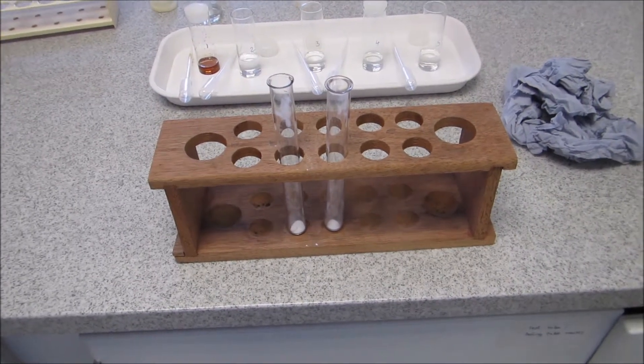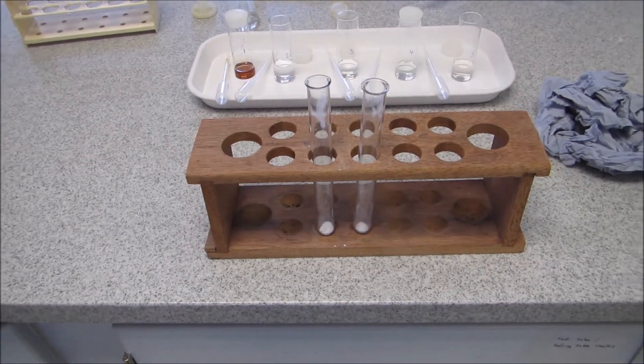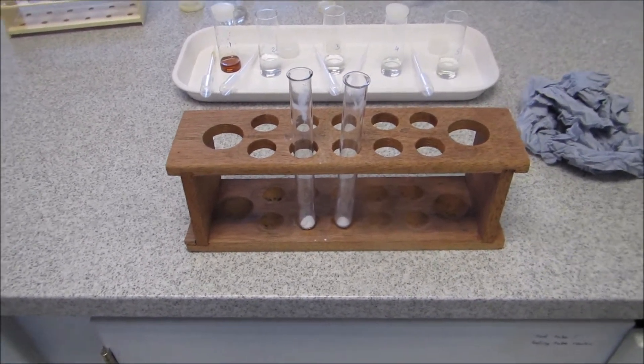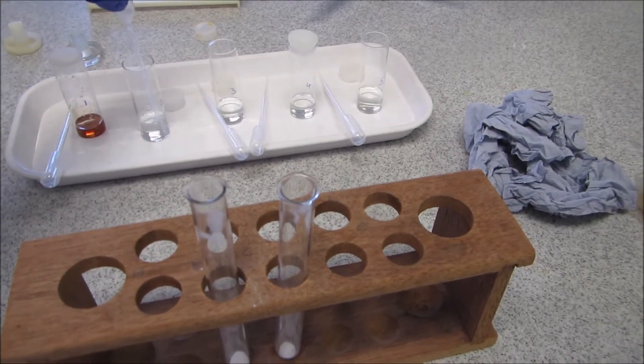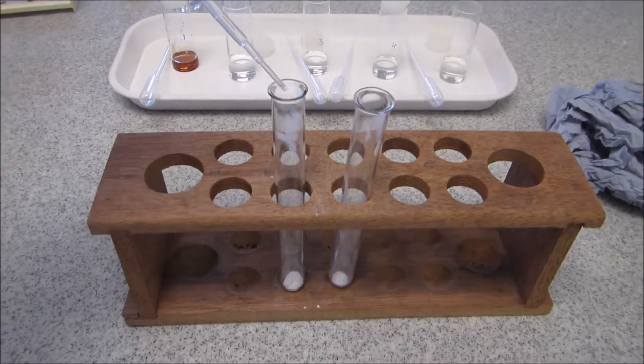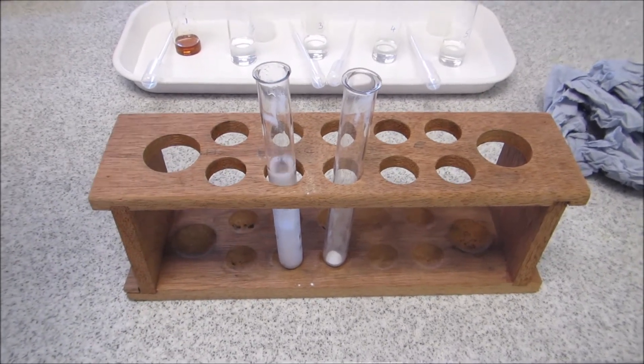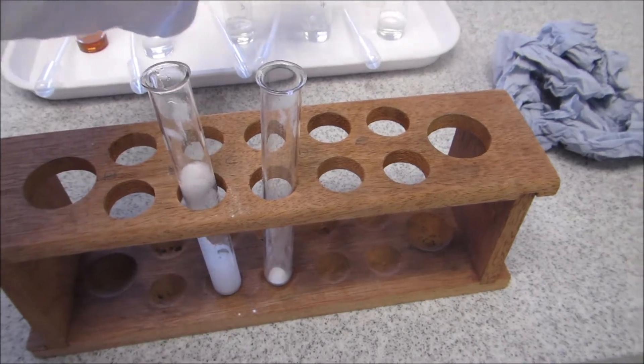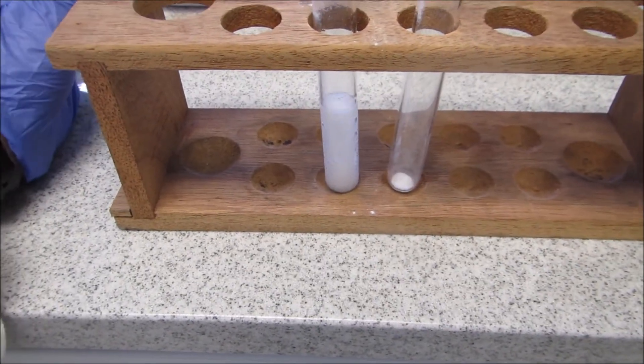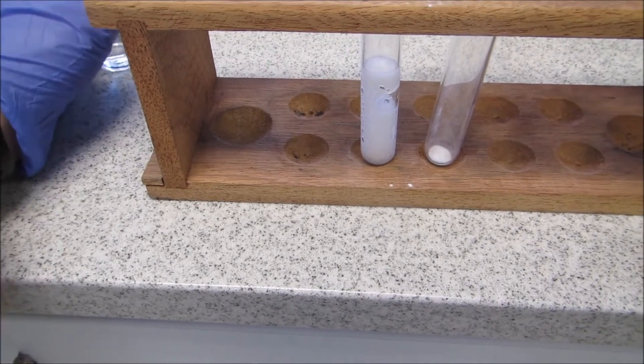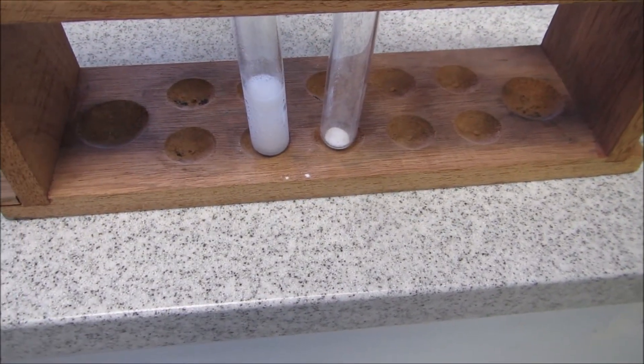The next thing to identify our organic groups is I'm going to react number two and four with sodium bicarbonate. So firstly, this is number two. Note the reaction. And what does that mean? Second, I'm going to do number four.